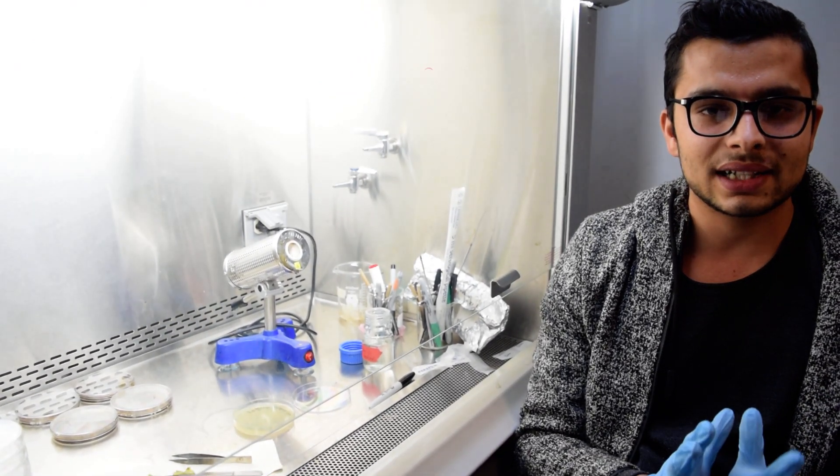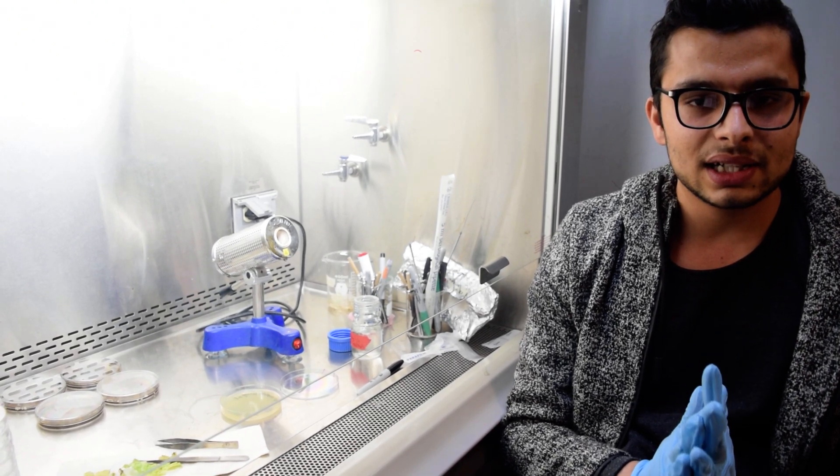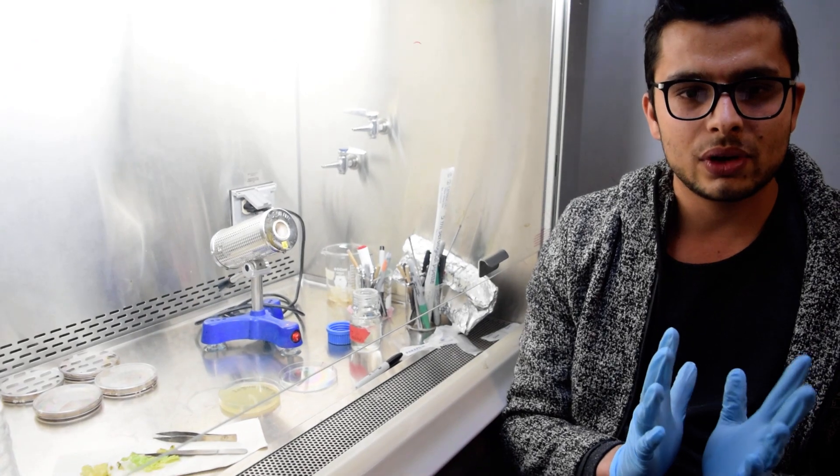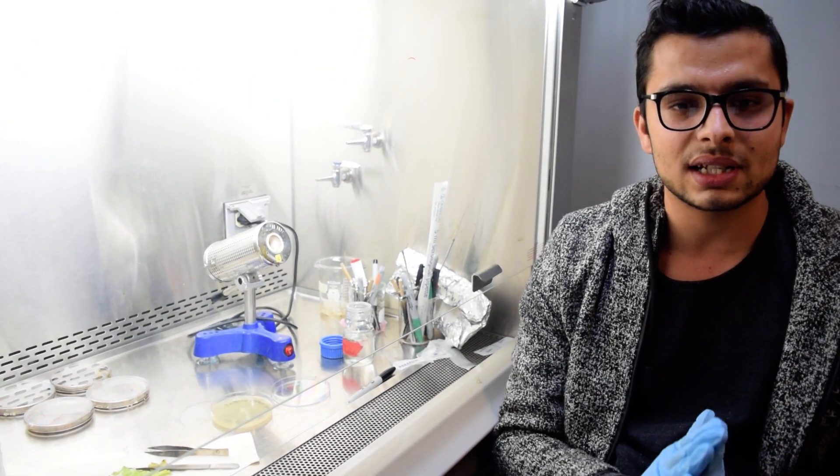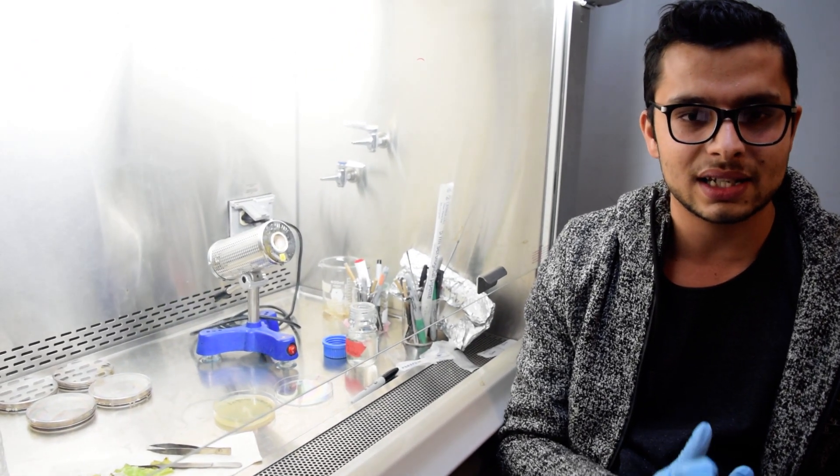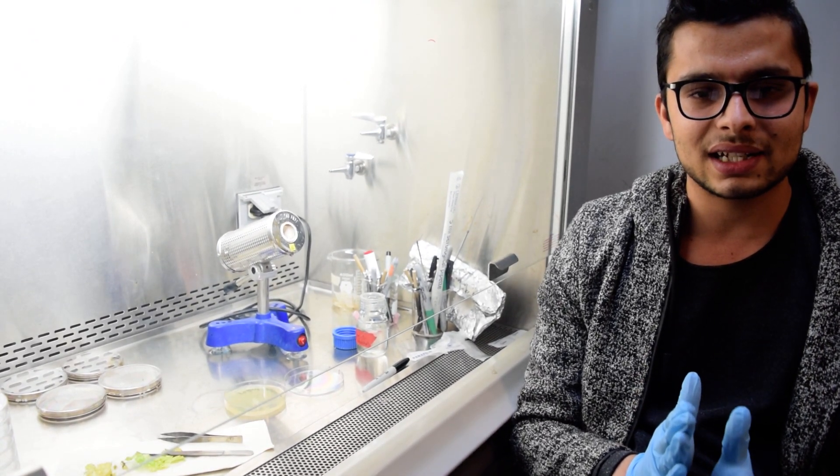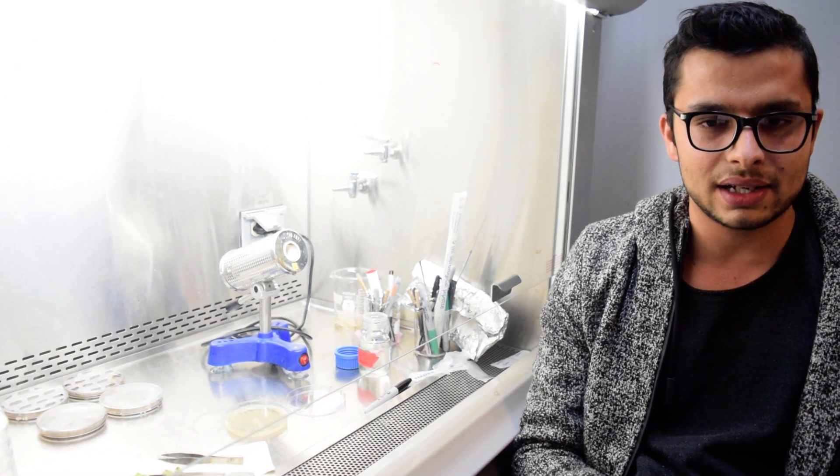At first, we collect the samples from the infected field. After sample collection, the collected samples go through disinfection. We wash the samples with 0.1% sodium hypochlorite solution for 30 seconds, followed by rinsing in water for 30 seconds. You can repeat the rinsing in water as many times as needed.